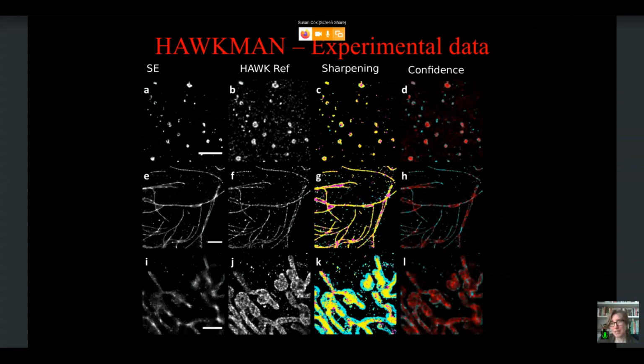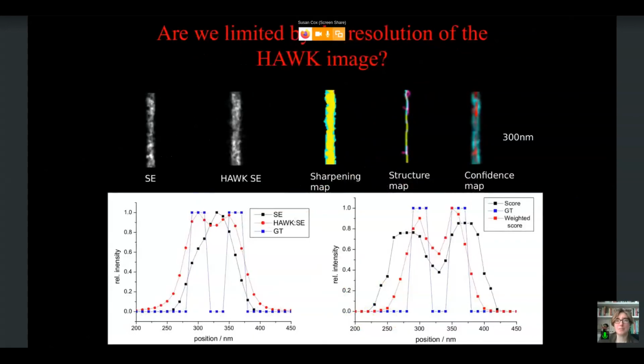But we wondered whether there was actually something else, because there are still differences between the hawked and the non-hawked images, even when there's no visible structure. So what we did was we used a structure. In this case, this is a simulation, where we have 2 lines which are a certain distance apart, but the data is not good enough to show it in either the single emitter or the hawked single emitter image. So we can't see any structure in the hawked image, and we can't see any structure on the single emitter image.